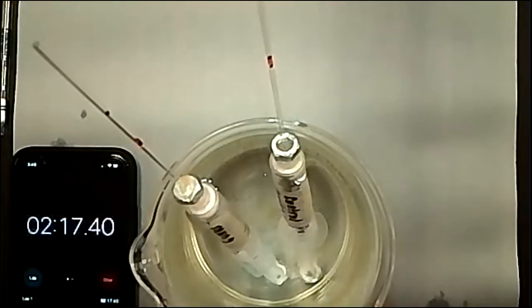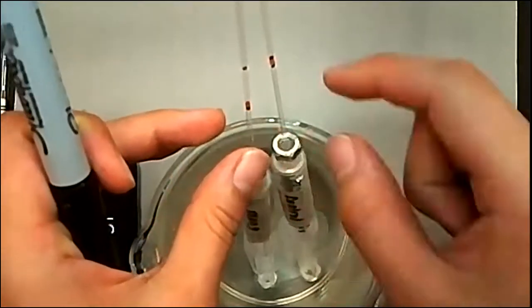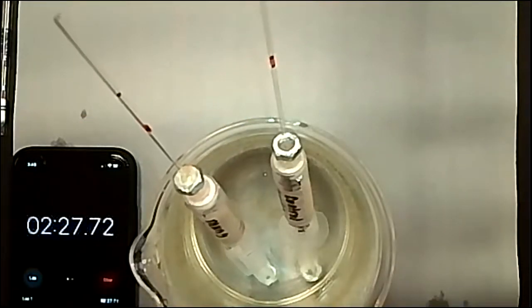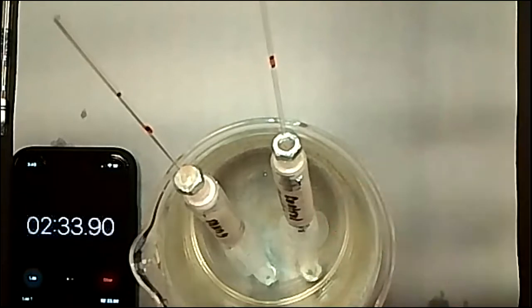one. So as you can see, the manometer fluid in the one with the cellular respiration with the mung beans is moving quite a bit already. And the reason it's moving is because the washers are heavy, but they're not heavy enough to actually keep all of this sunken because there's obviously gas inside of the cellular respiration respirometers because the plants are using up the gas, and there's gas in between the gaps in the cotton.